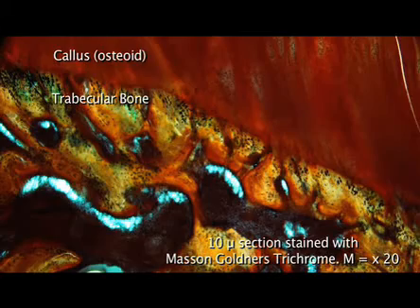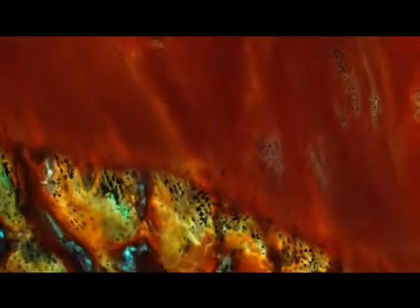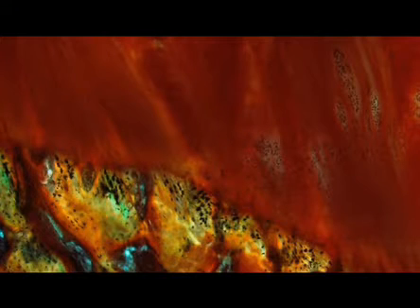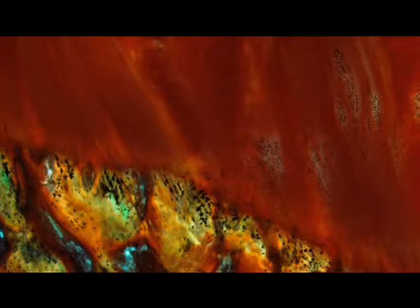Undecalcified bone histology demonstrates the micro-architecture of bone, showing both the mineralised and cellular components of bone, providing vital information on bone turnover or bone formation and resorption. This has tremendous importance in a variety of clinical and research applications. It provides beautiful images and allows for techniques such as fluorochrome assessment and histomorphometry.